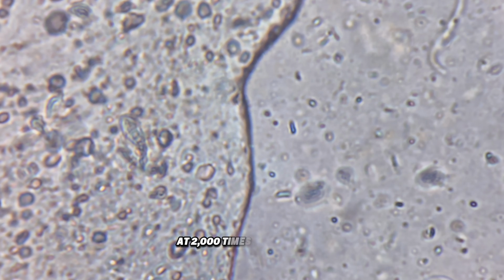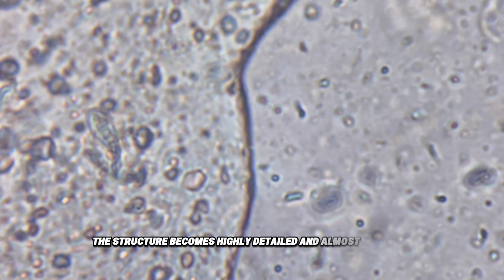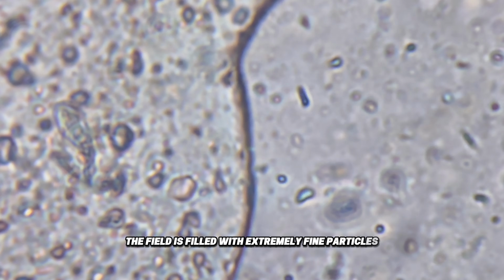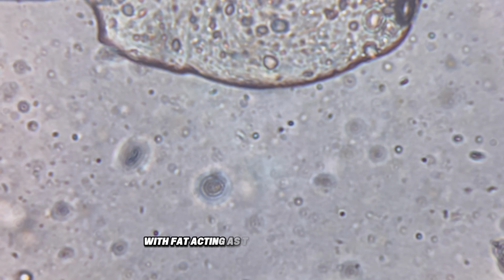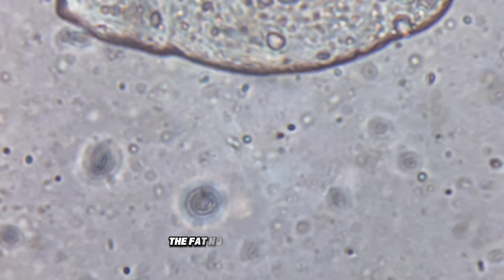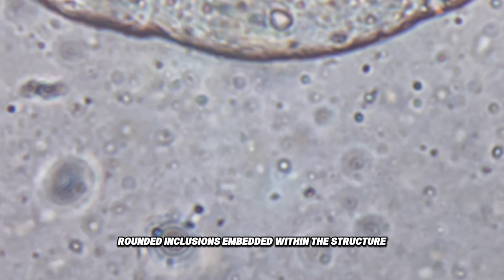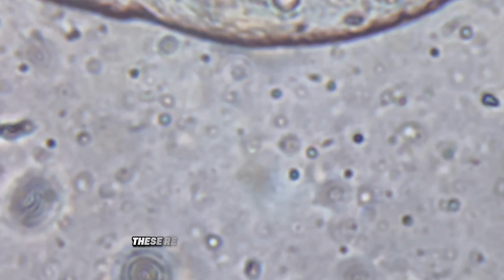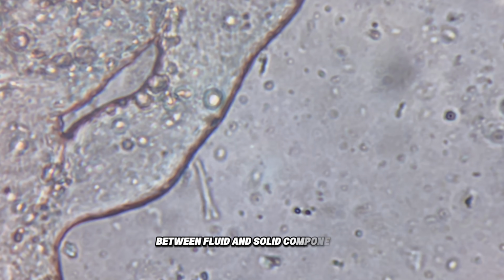At 2,000 times magnification, the structure becomes highly detailed and almost abstract. The field is filled with extremely fine particles, forming a dense and continuous matrix, with fat acting as the binding component that holds everything together. The fat now appears as smooth, rounded inclusions embedded within the structure, often surrounded by tightly packed protein fragments. These regions create strong visual contrast between fluid and solid components.